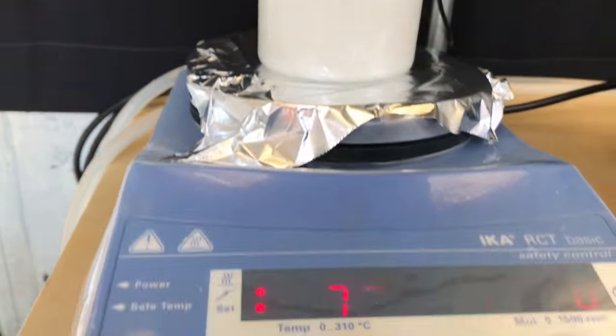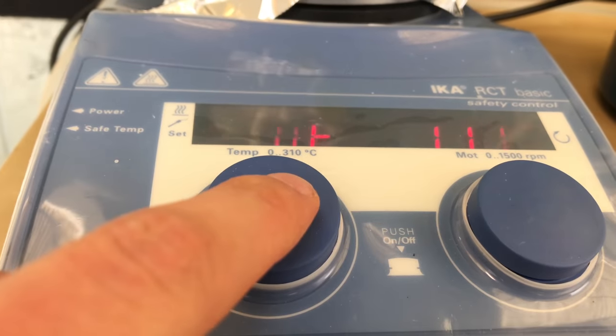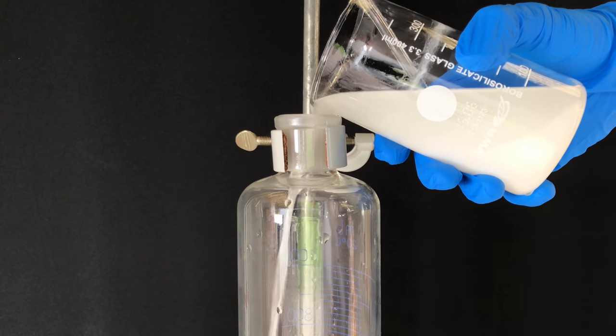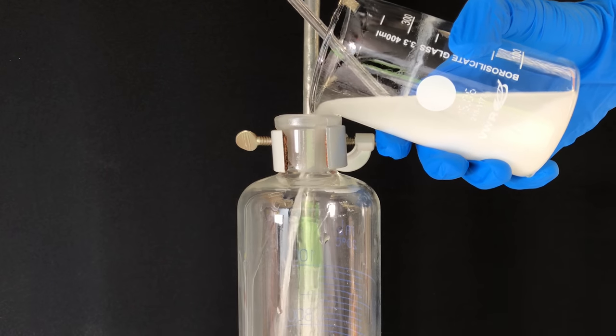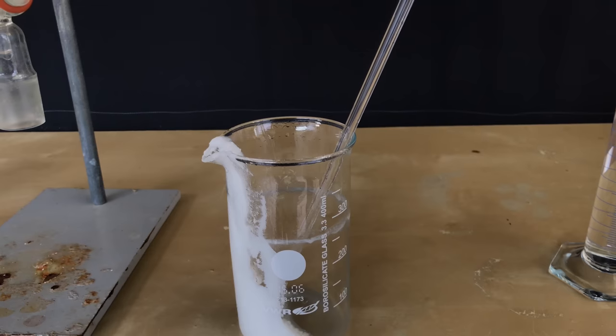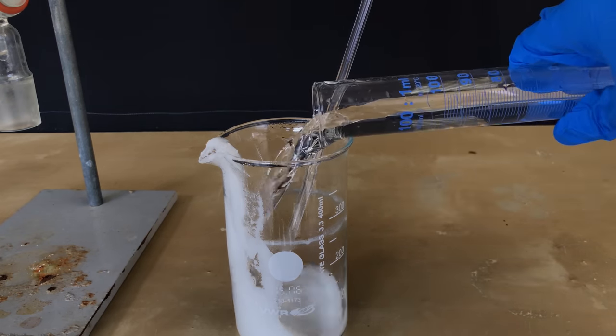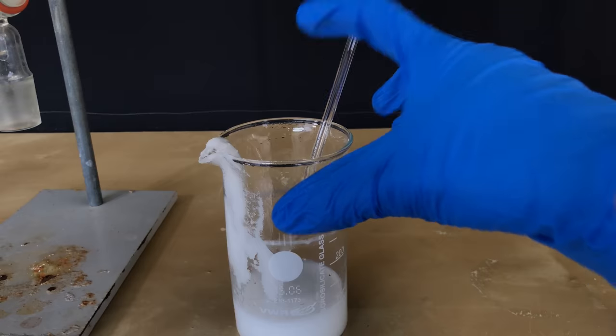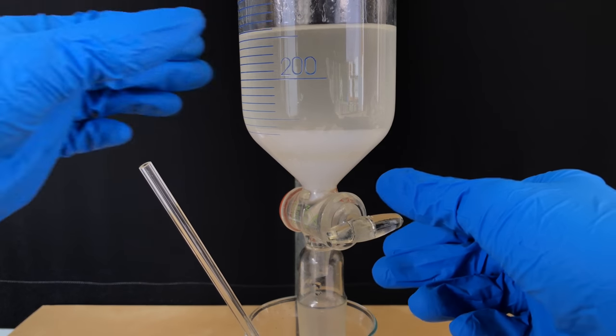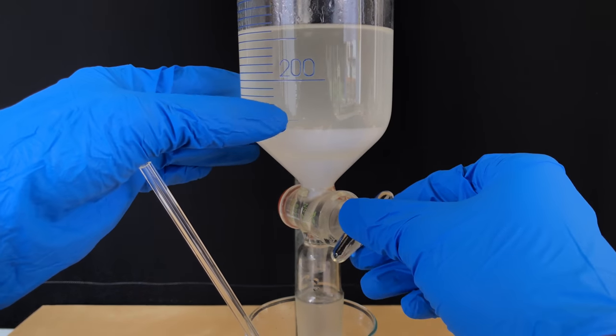90 minutes have passed now. We turned off heating and stirring, allowed the beaker to cool back down to room temperature, and added the slimy stuff to a separatory funnel. To remove the majority of potassium carbonate and to get the leftovers from the beaker into the funnel, the reaction mixture was shaken and washed with 75 ml of distilled water. The waste was contained in the bottom layer, which was drained off.